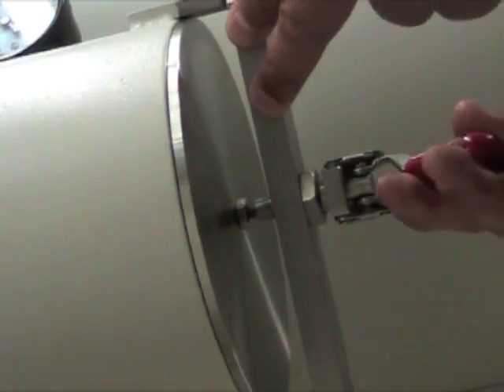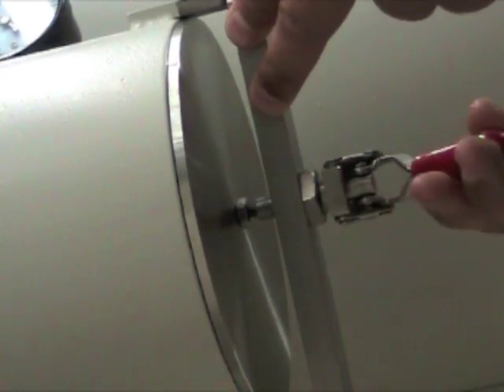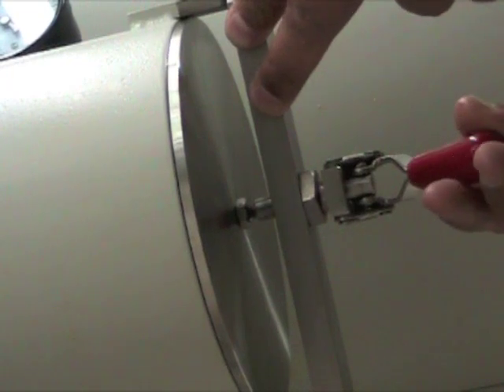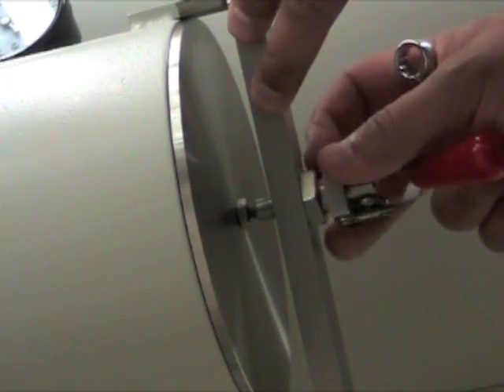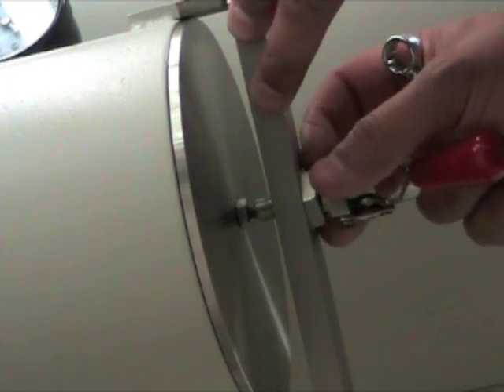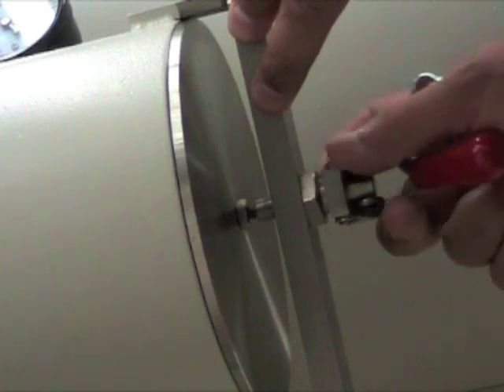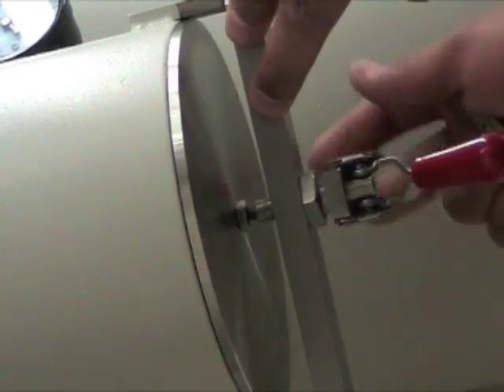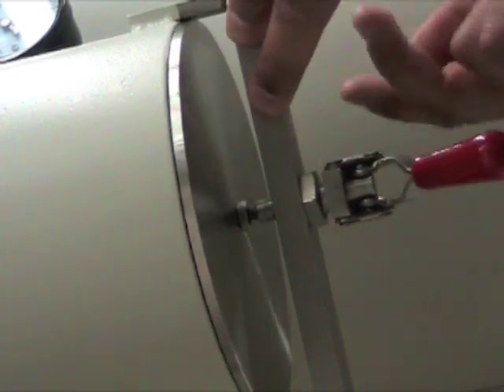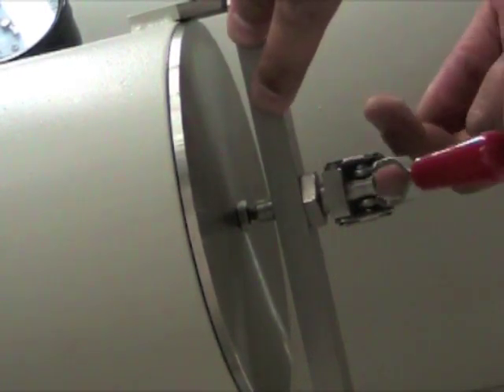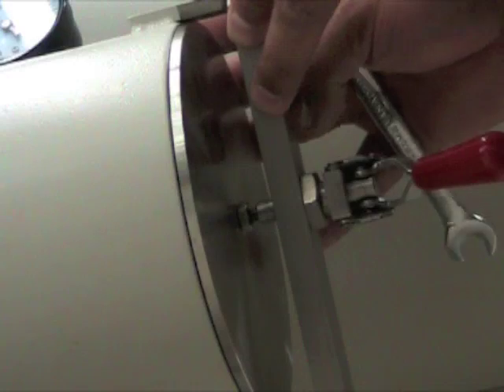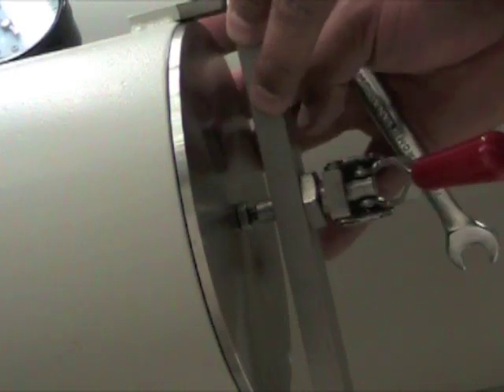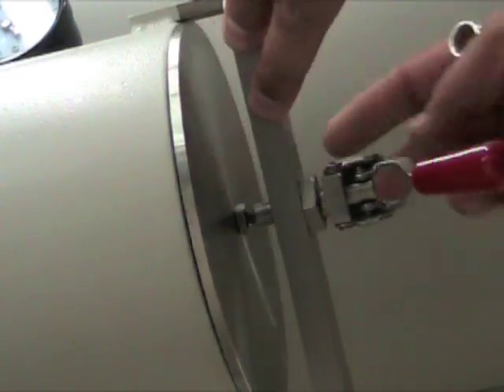That's a whole lot of tension there. We do not want that. Once again, that'll put a whole lot of strain on the door clamp mechanism. But yet we don't want it too loose either because we want this to hold a good vacuum.